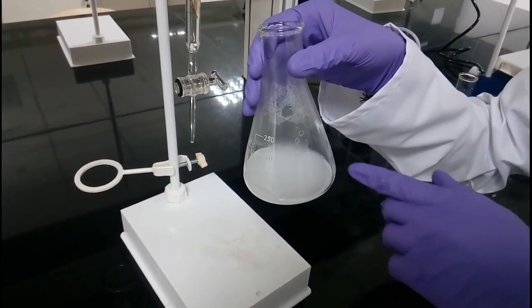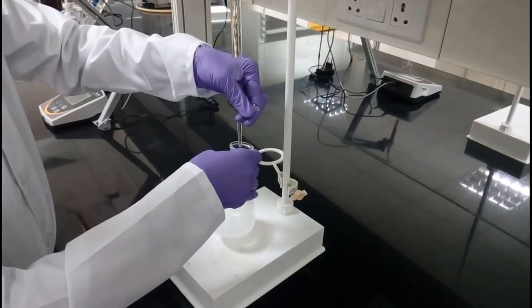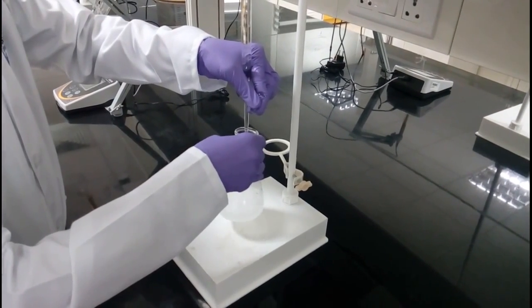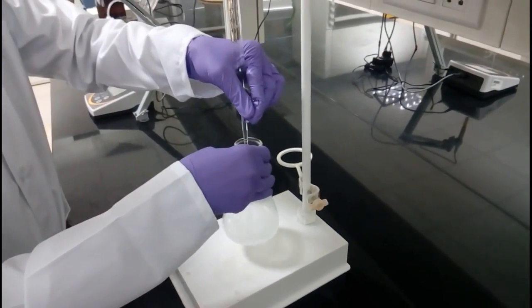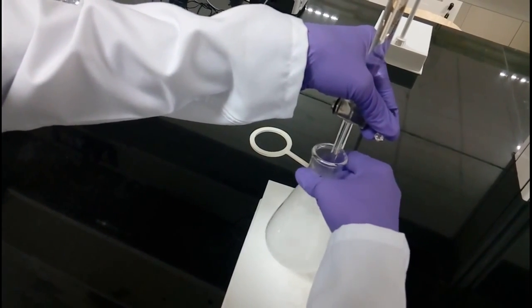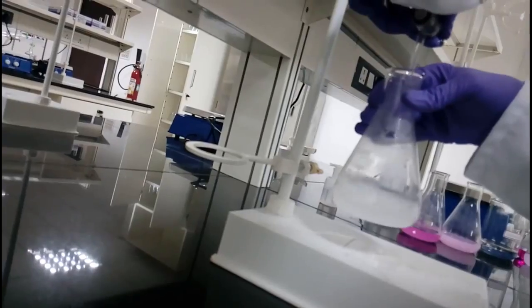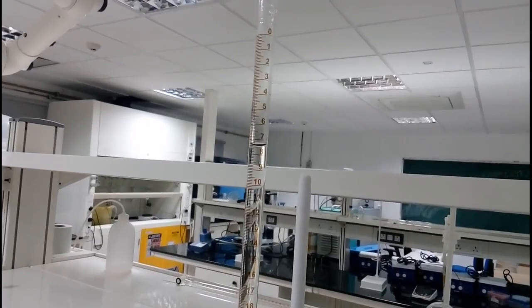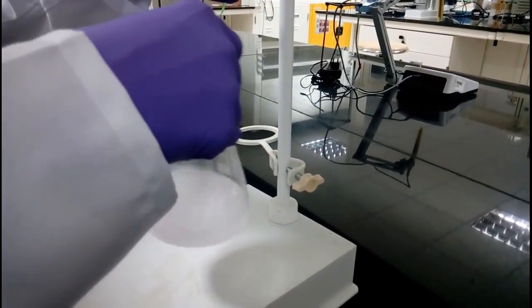Titrate this solution with 0.1 normal NaOH. At the titration endpoint, the solution should be pale pink.